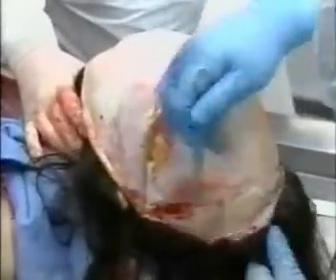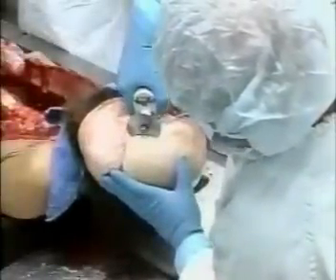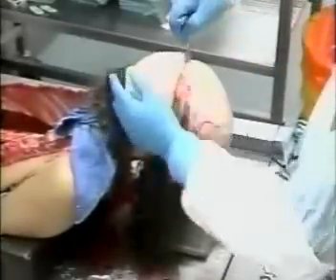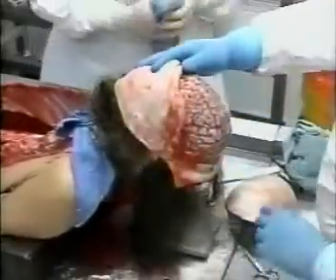He's now reflecting the scalp — the front has been done, and now he'll reflect the posterior portion. Now that all of the incisions have been made, he'll use the key in order to free it up and peel it off from the dura. And as you can see, now the brain has been exposed.